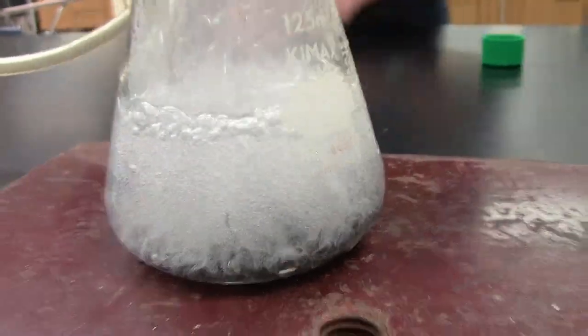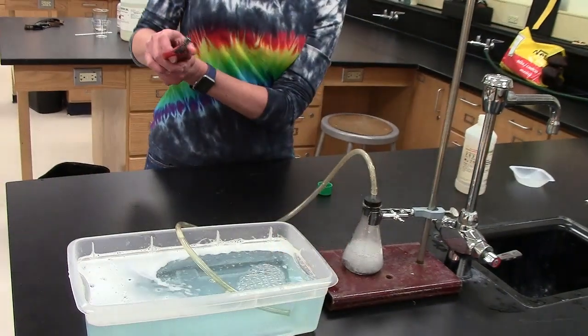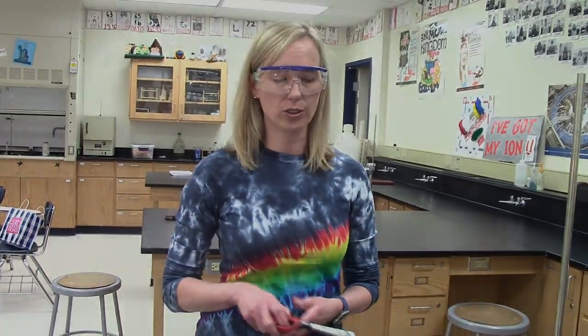So again, let's try to light a little bit of this on fire. We'll do this a few times just because it's so entertaining to me. Woo! That was a loud one, right? And the hydrogen is reacting with the oxygen in the air when I give it that extra energy from the flame, very similar to the balloon that we saw not too long ago. So I'm actually doing a single replacement, but then I'm doing a synthesis reaction when I'm combining the hydrogen gas with the oxygen.